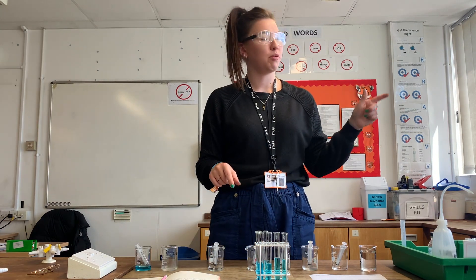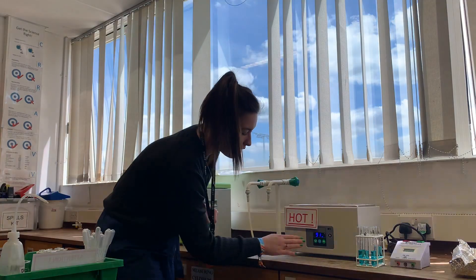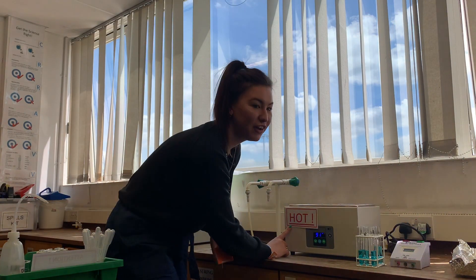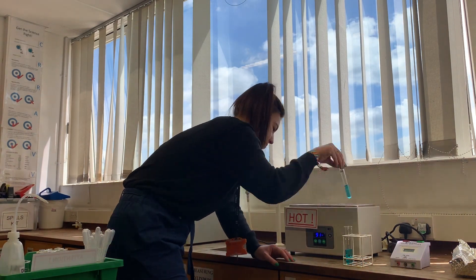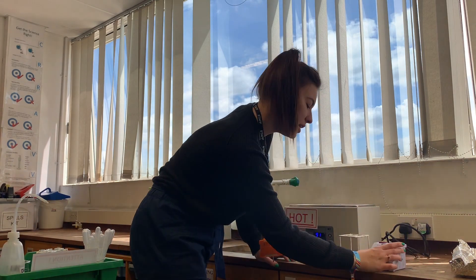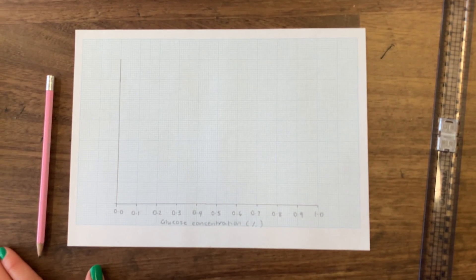Next we're adding five centimeters cubed of quantitative Benedict's solution to each of our test tubes. With Benedict's solution added, we need to pop them into our water bath for 15 minutes. Our water bath is up to 91 degrees - it is very hot - so I'm just going to pop these straight in, and I'm starting the timer for 15 minutes.